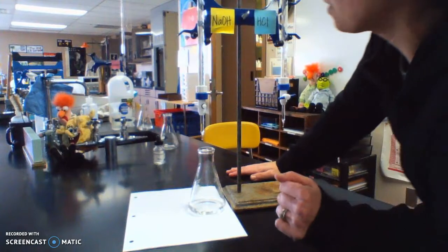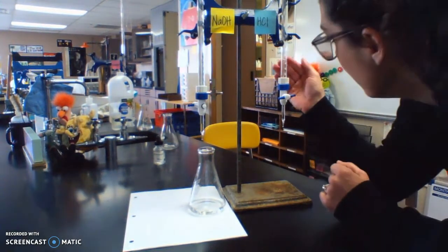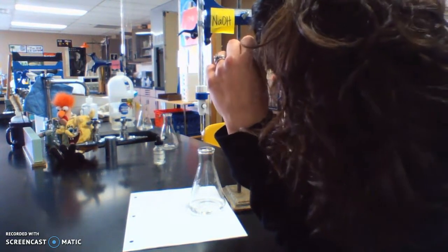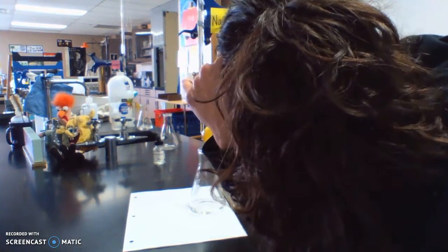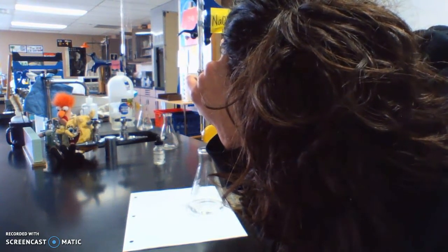All right, so this one ends at, actually, let's do our acid first. So my acid end volume is, let me see. Sorry, it's not a great view of just the back of my head. 47.23.